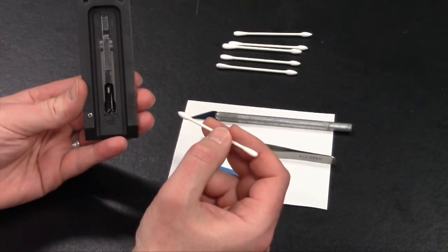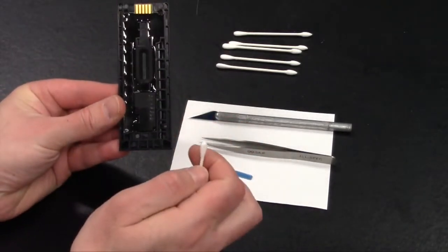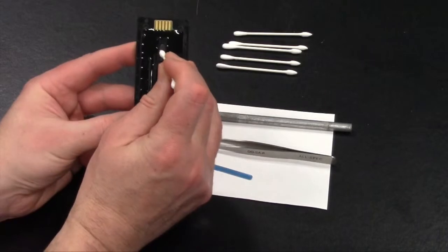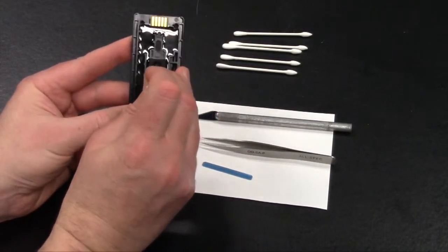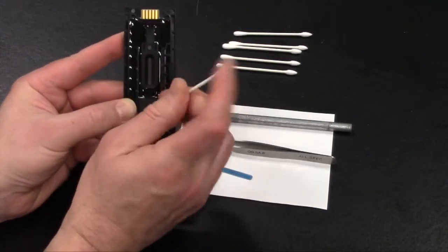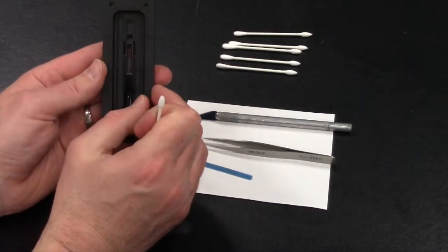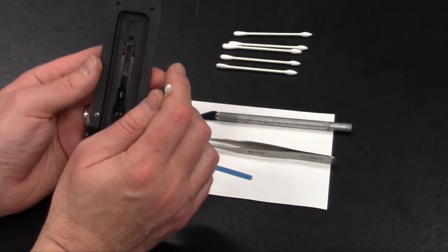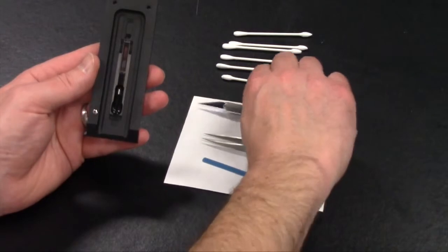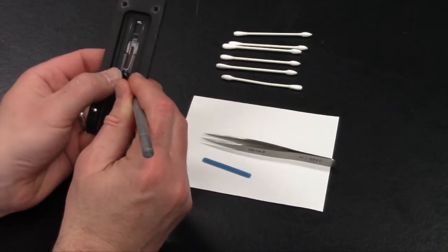To replace this optical window, turn the slide over to expose the bottom, and using a cotton swab, using the rough end of the swab, gently push against the plastic in this small top window and also push in this bottom window. What will happen is you will remove the plastic lens. It will sometimes break, and then you can use an X-Acto knife or a small sharp tool to remove the remaining plastic that's left in the slide assembly. We want to remove any remaining pieces of this slide before we replace it with the new one.